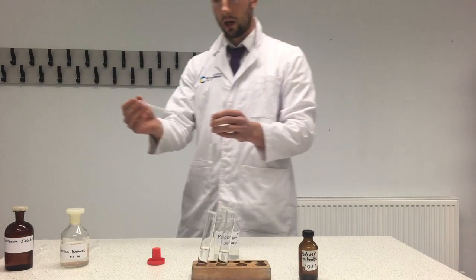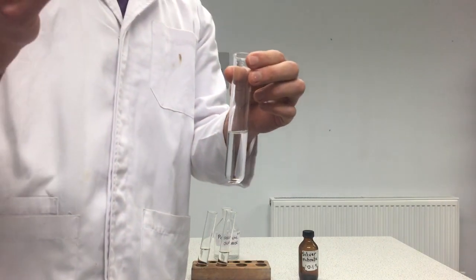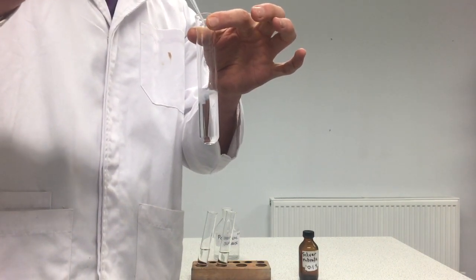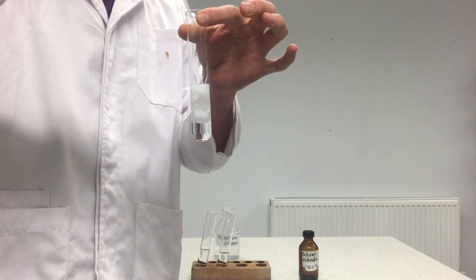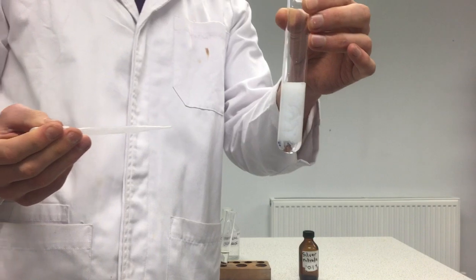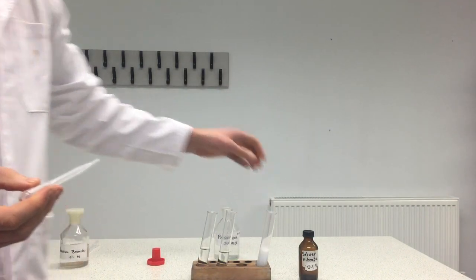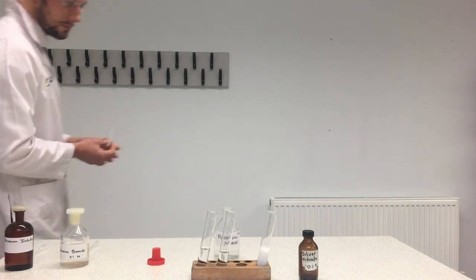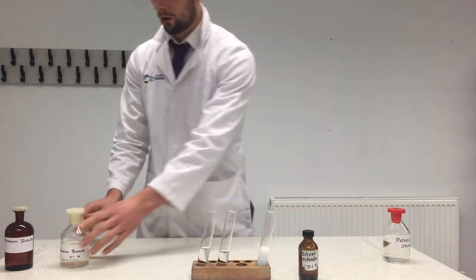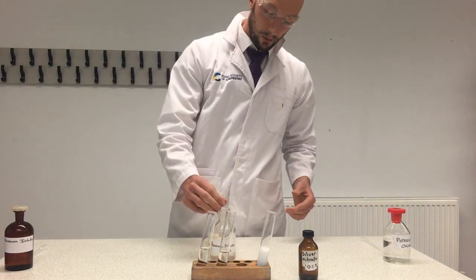I'm going to come around and show you this nice and close to the camera. Here's my boiling tube — if I add my potassium chloride, we can see straight away it looks milky or cloudy. That was potassium chloride.